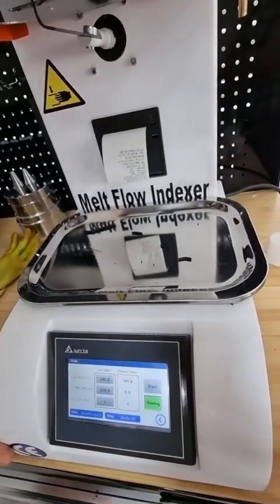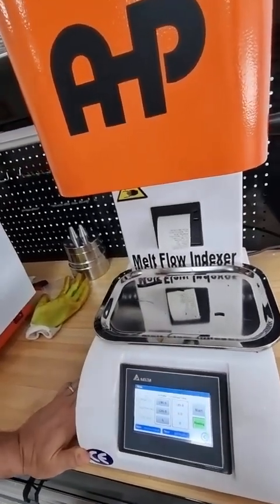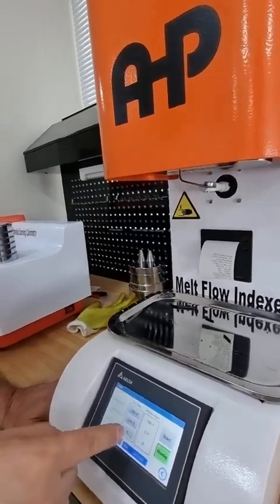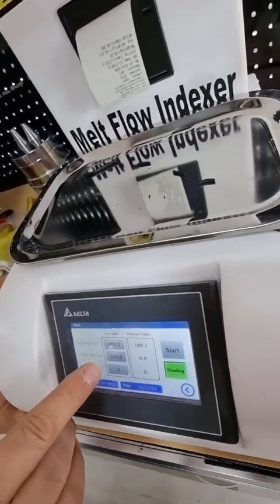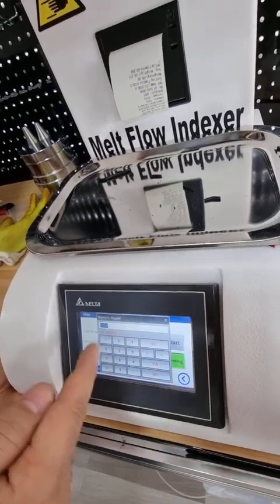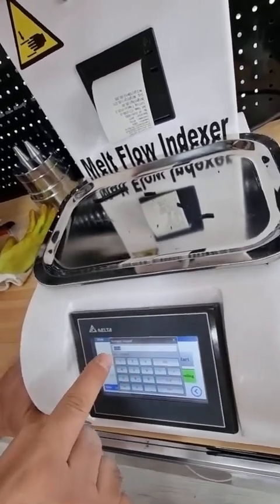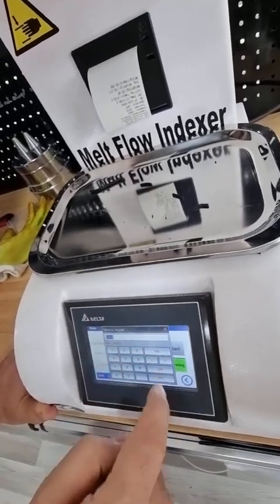For the temperature, you need to check the specification of the material — what the MFR measurement temperature is for that specific material, whether it is 190°C, 230°C, or otherwise. The cutting time is defined based on the table in ISO 1133: 5 seconds, 15 seconds, 60 seconds, 120 seconds, 240 seconds — defined based on the melt flow rate per ISO 1133 standard.